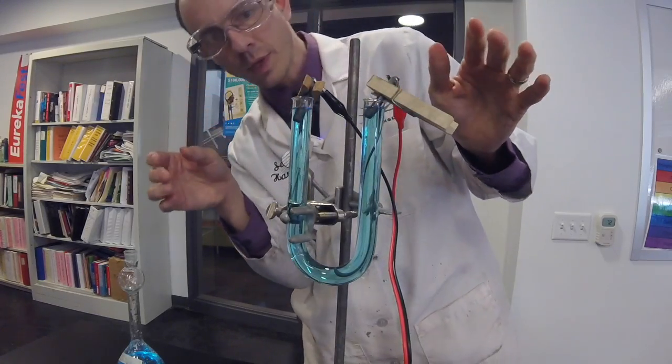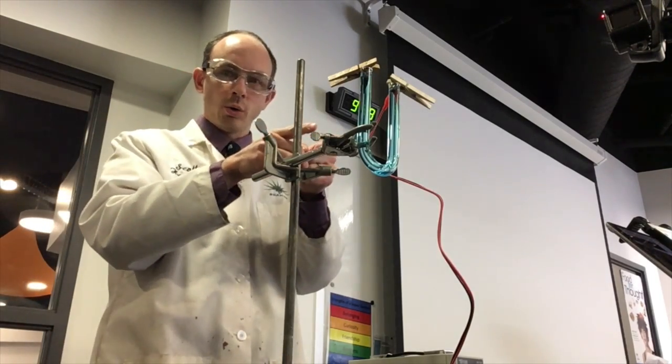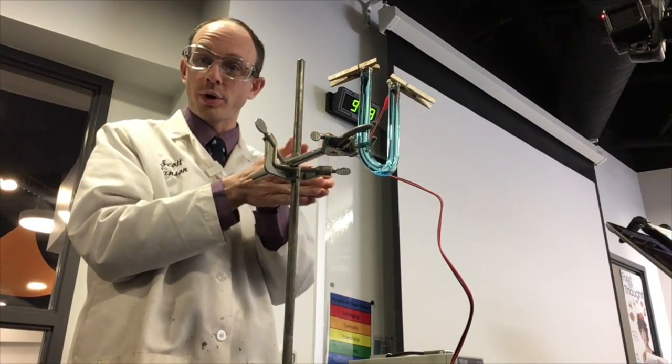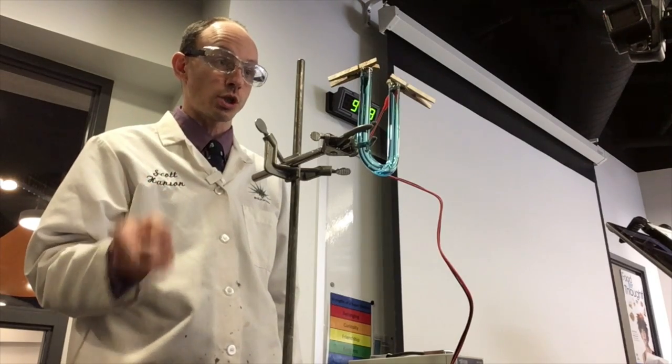And now, based on the work that you guys did last class, you know from a prediction which one of these two is going to generate chlorine and which one is going to generate copper. So let's see if your prediction is correct.